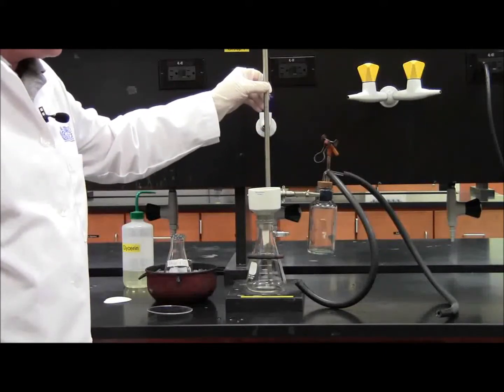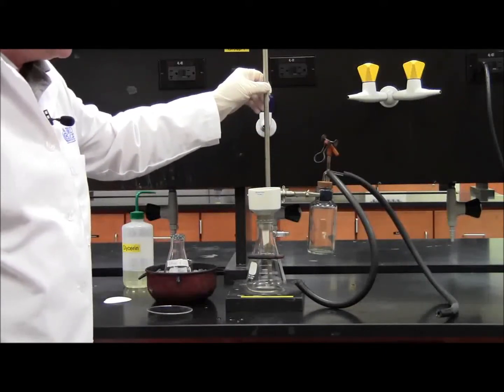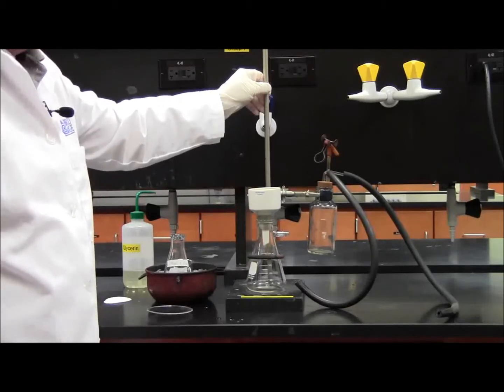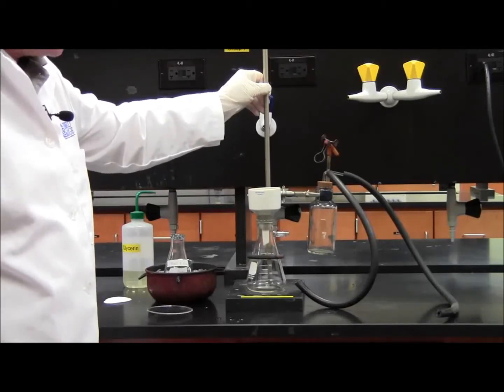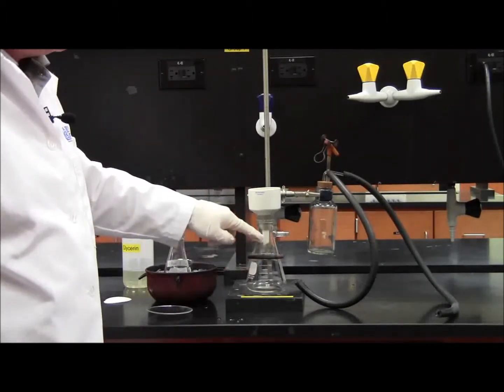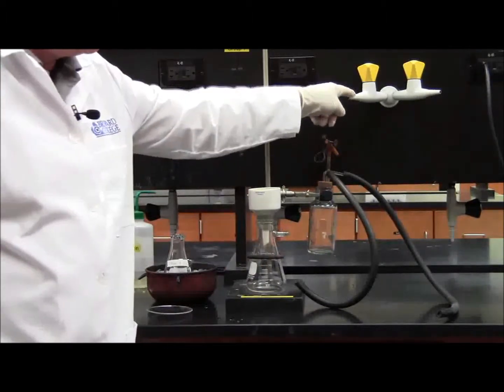I took out the vacuum apparatus, which you'll find in one of your cabinets. It should come preassembled. All you have to do is hook up the vacuum hoses to the vacuum flask and to the actual vacuum.